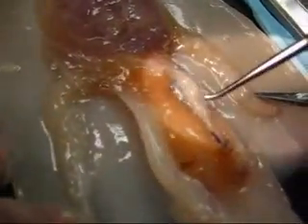Over here is the anal flap. Inside here is where the anus is. This is the ink sack over here — silver, shiny stuff. These are gills on each side.